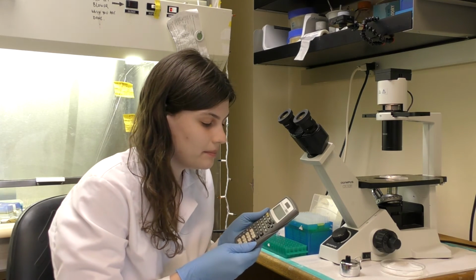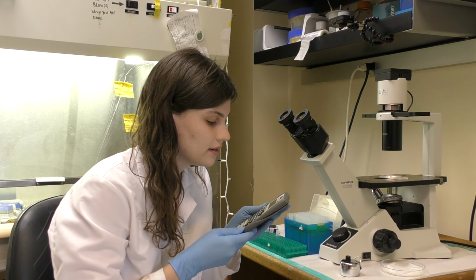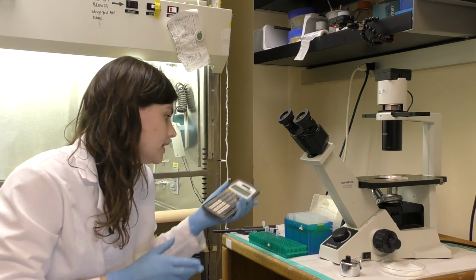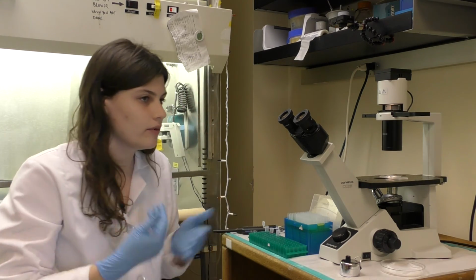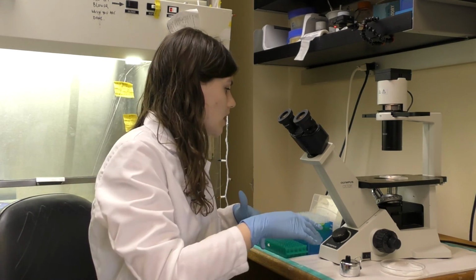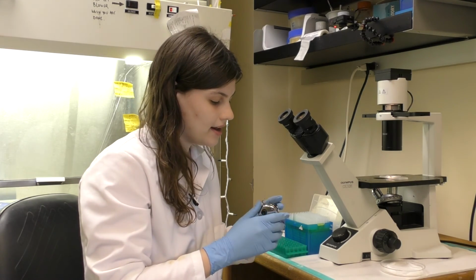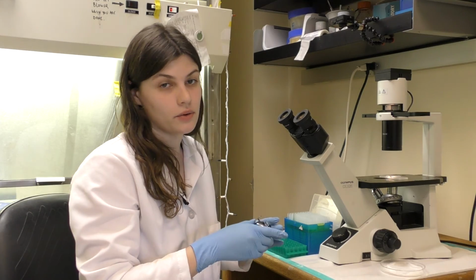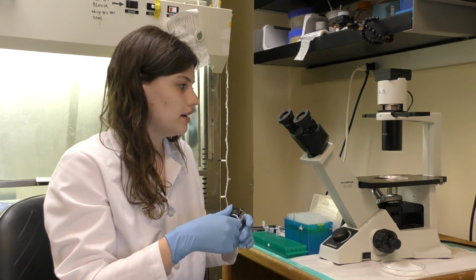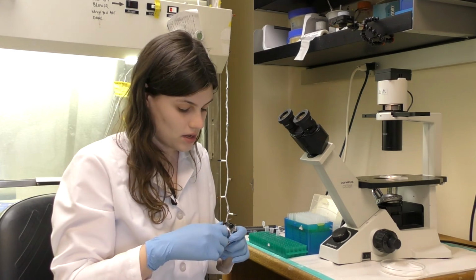I had about 7 million, a little over 7 million cells in that. So if I want to plate my densities, you can look on Thermo Fisher and other places for your size, like what well plates you want, and figure out a seeding density and then a maximum density of your culture dish. And then you can grab as much from your original suspension as you need and plate that.